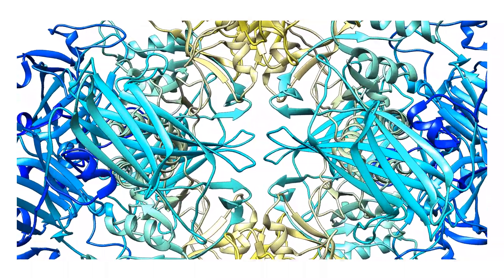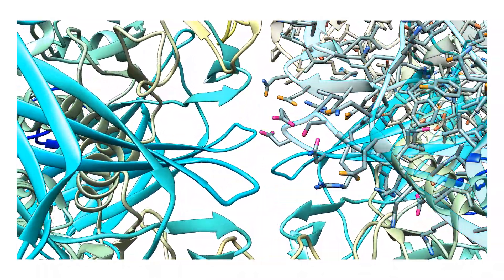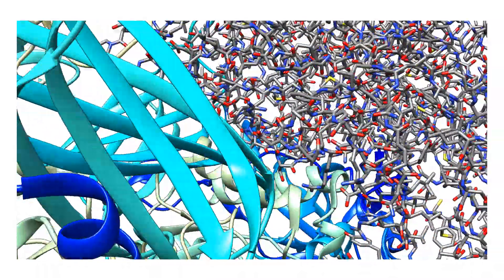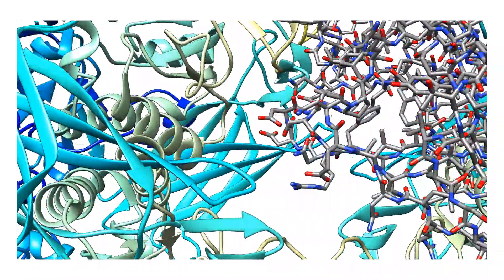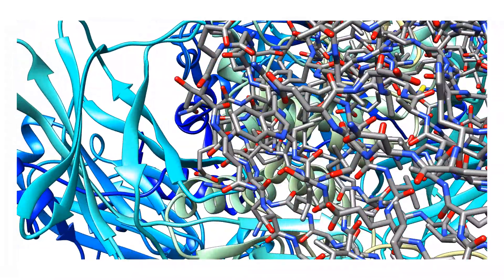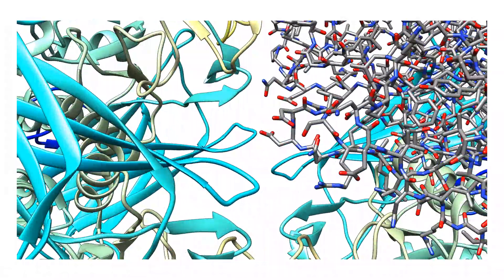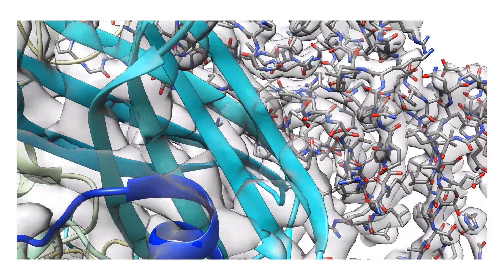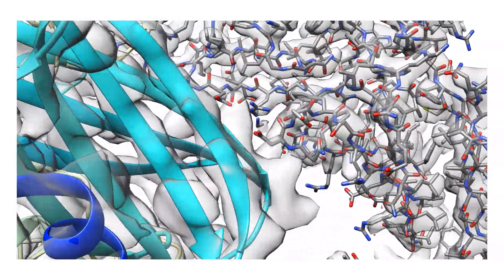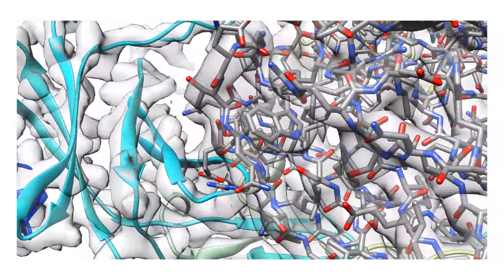They are kind of like small molecular statues, and then we take images of them from a variety of angles and orientations and we combine these images to get a design plan and an organization for how these molecules are put together.